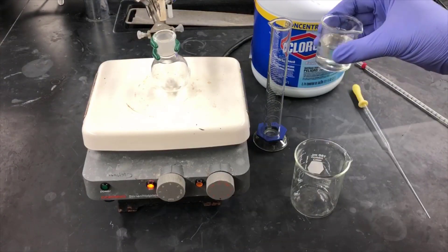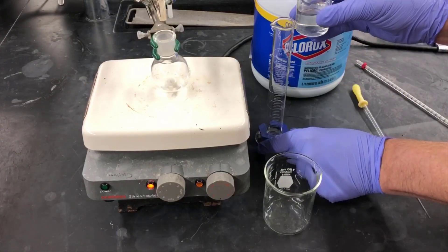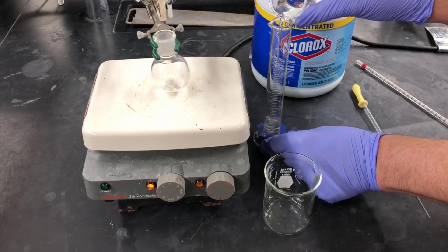I have some bleach in this beaker, and I'll be measuring out 24.0 milliliters to add to the reaction solution.